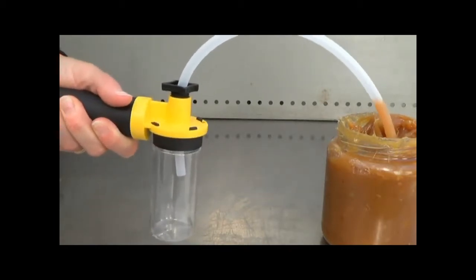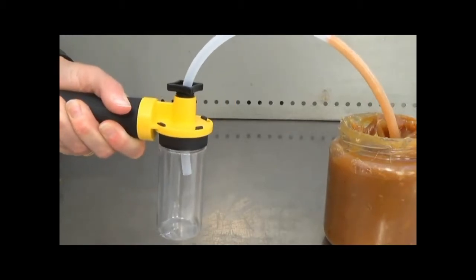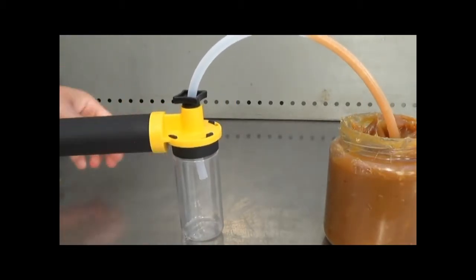This is grease sampling so just pump up the maximum vacuum and let the pump do its work whilst you make yourself useful with something else.